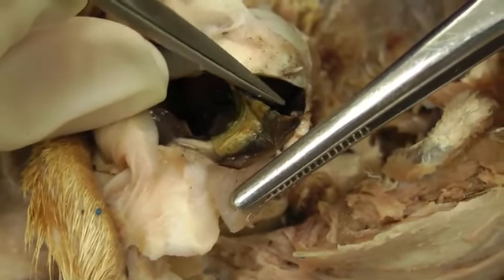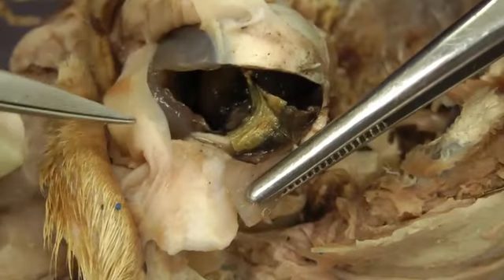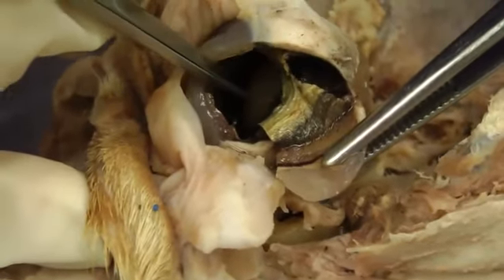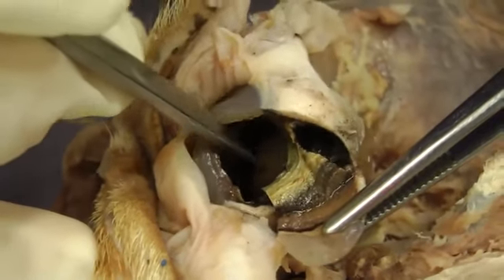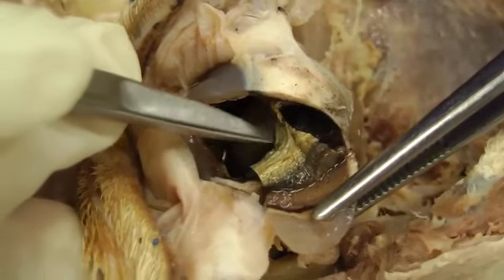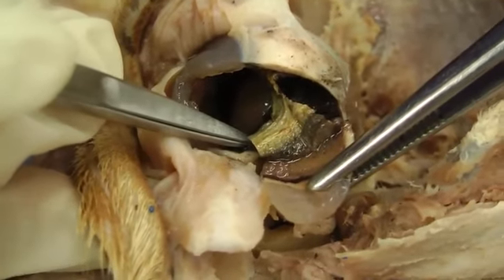And that has the ciliary processes and then the zonular fibers, and that's the suspensory ligament for the lens, which we can see the lens right down in there. Kind of fell through there. The lens is right there. And so that would be suspended here by those zonular fibers.